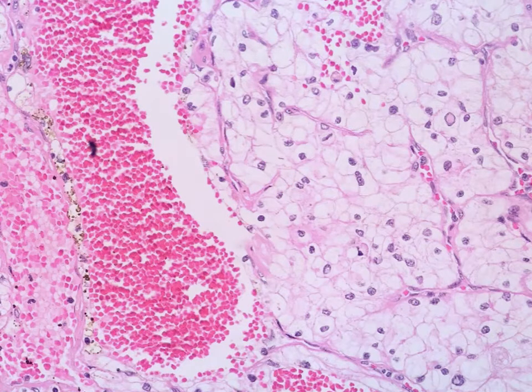So you can see in this picture, there are groups of cells that have clear cytoplasm. Just to highlight to you, this one is one cell. You can see that this is the nucleus. I will find out the nucleus, which I circle in this yellow part. So this is the nucleus.